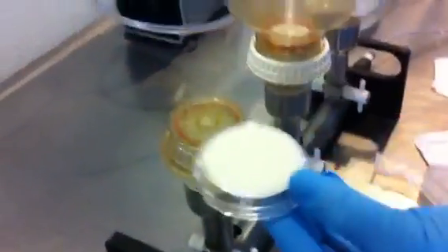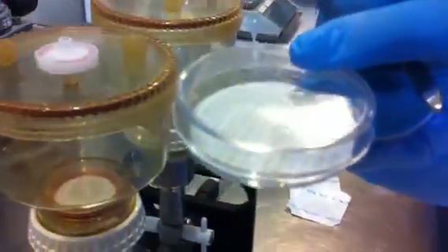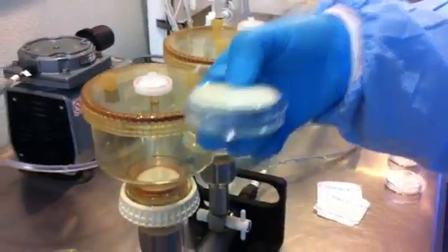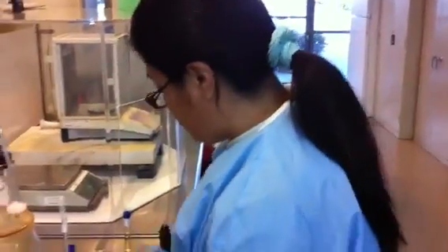And that would be how you incubate them — upside down. That's why you soak it just enough, so you can flip it down like that and it'll stick. That is your basic lesson in membrane filtration microbiology.